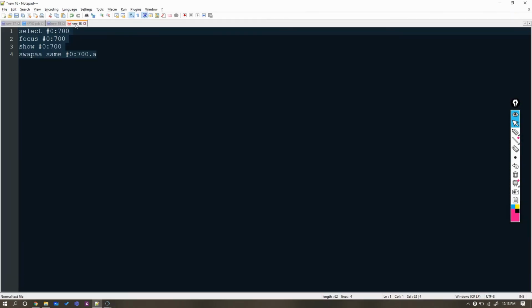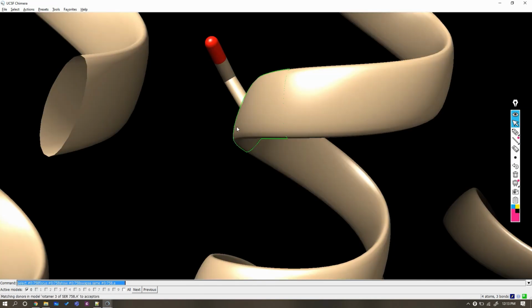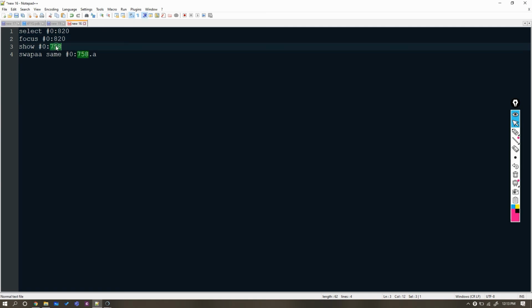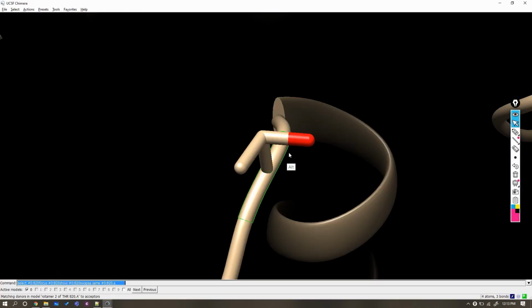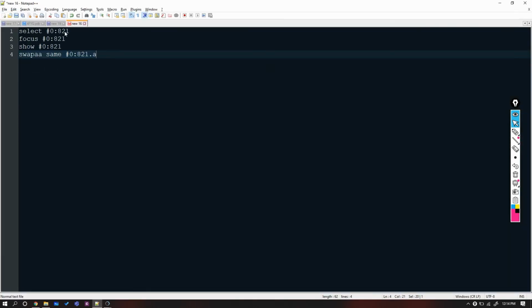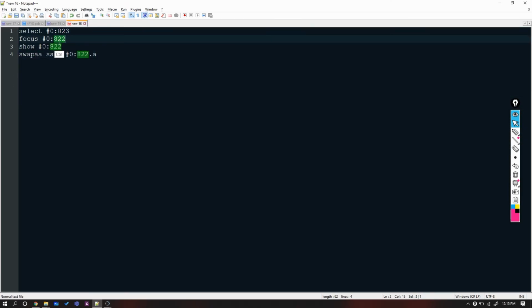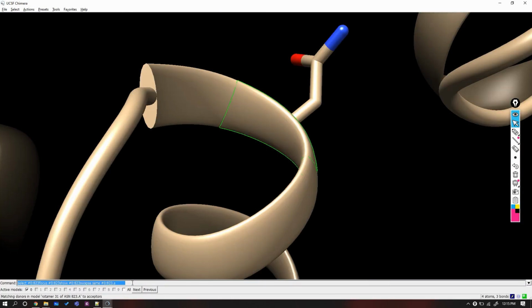Once again, we will change the residue number in all of these commands and then do the same. Please remember, it takes more time than others. Now I will do it for the other remaining duplicate residues. You can copy one command at a time and paste it as well to see the things separately if you want.